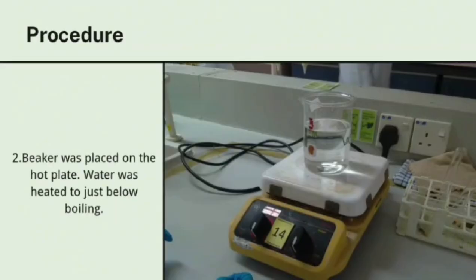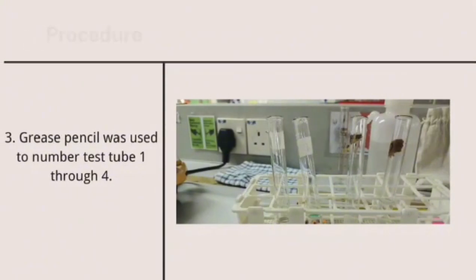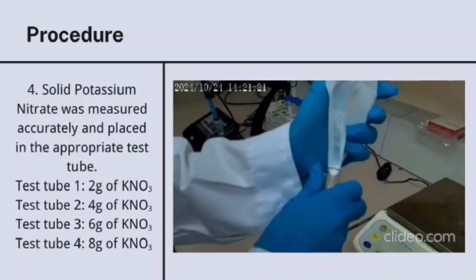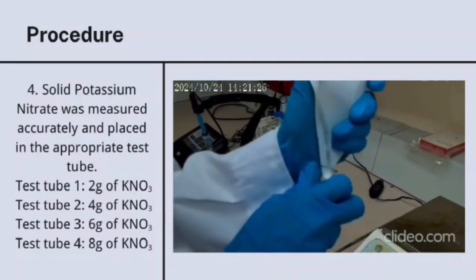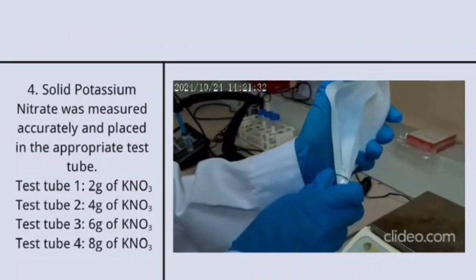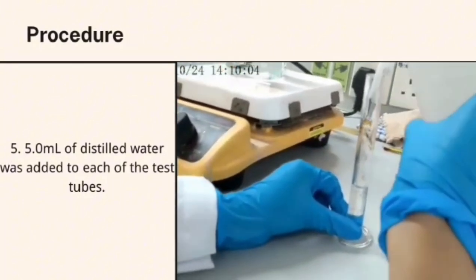Procedure 2. The beaker was placed on the hot plate and the water was heated to just below boiling point. Procedure 3. A grease pencil was used to number test tubes 1 to 4. Procedure 4. Solid potassium nitrate was measured accurately and placed in the appropriate test tube. For test tube 1, 2 grams of KNO3; test tube 2, 4 grams of KNO3; test tube 3, 6 grams of KNO3; and test tube 4, 8 grams. Procedure 5. 5 ml of distilled water was added to each of the test tubes.